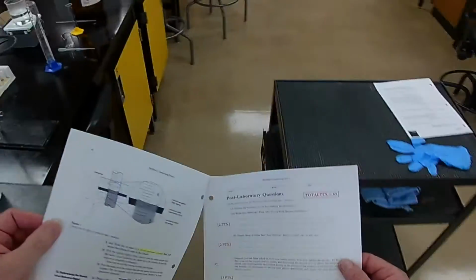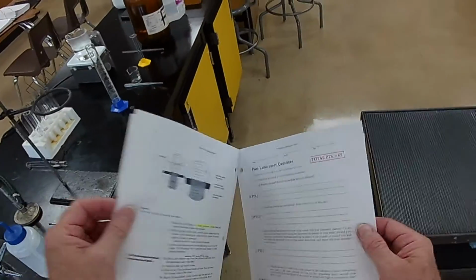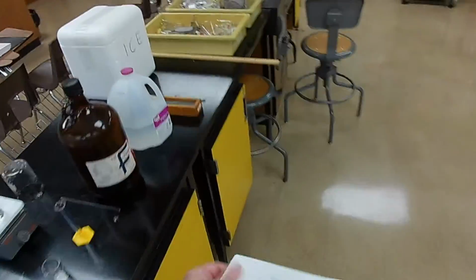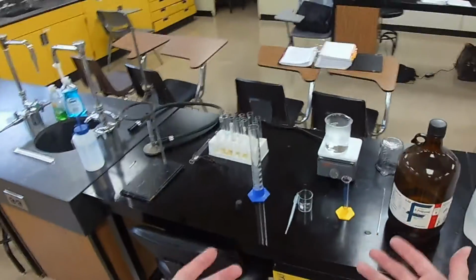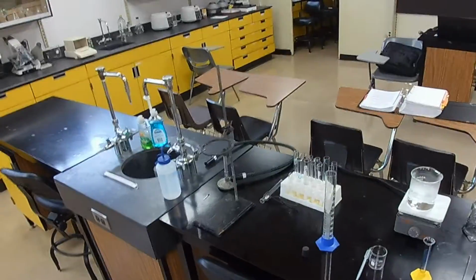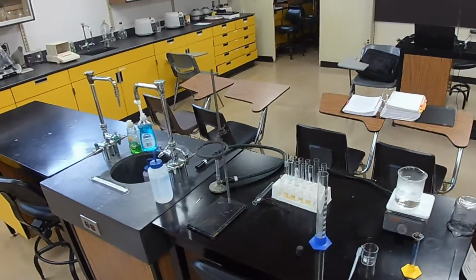All right. So that was the pre-lab questions. Now we can get to the lab itself. And we need directions. Here we go. And of course, you should have read this before you start the video. Right? Anybody that walks into a lab and does not first know what they are going to do in the lab before they walk through the door is not only unsafe, but they're a fool.